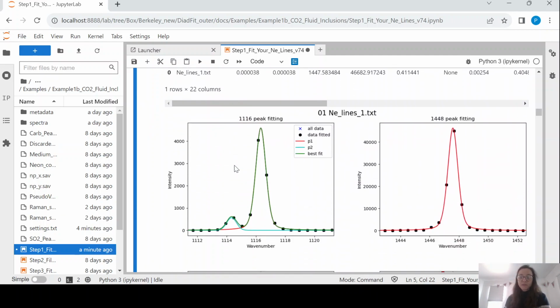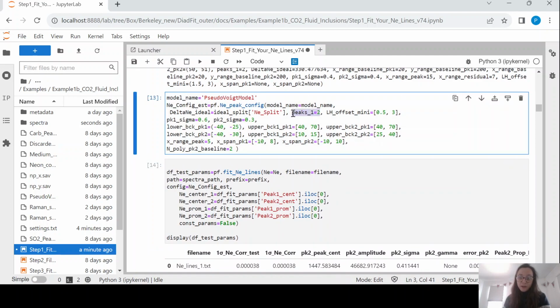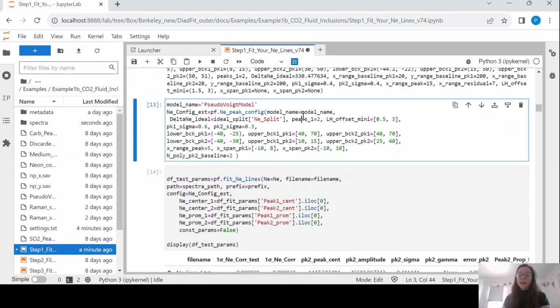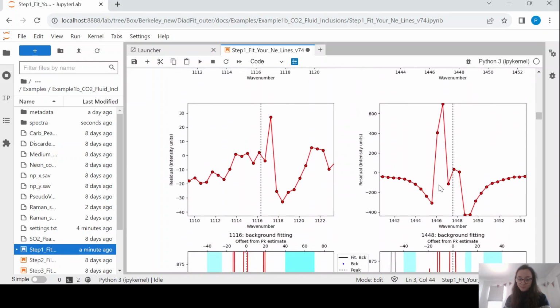So let's have a look down. So you'll see for the 1116, 1117 peak, there's actually a subsidiary peak on its flank. And this means we have to fit 2 peaks, otherwise we're not going to get the right value. So you can see up here, you set that with peaks 1, so peaks for the left-hand one, we're going to set that to 2. And then for the 1447, 1448 peak, we can fit it with a single peak. So we're happy with that.